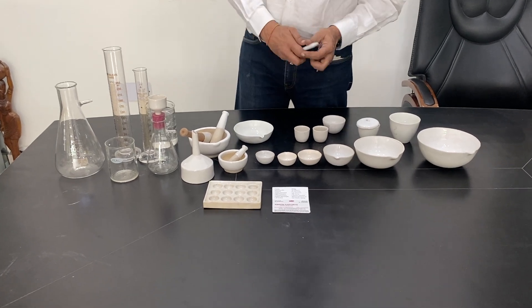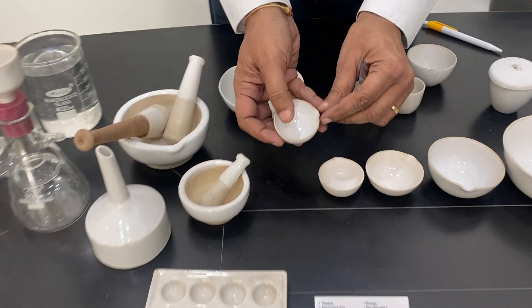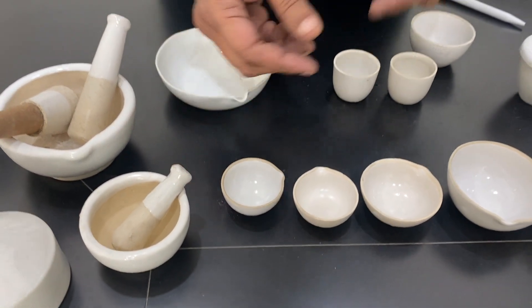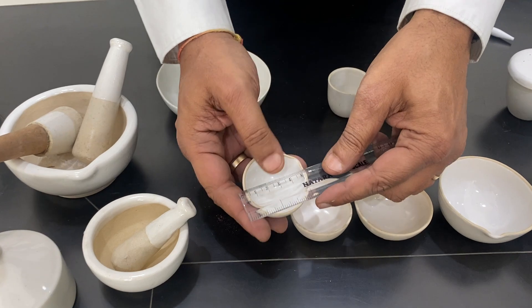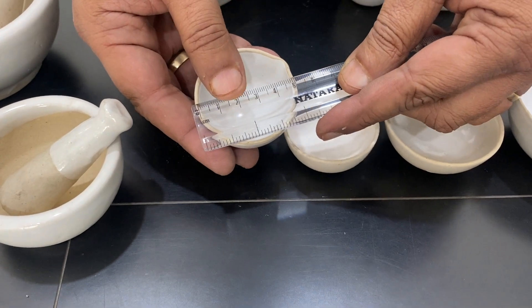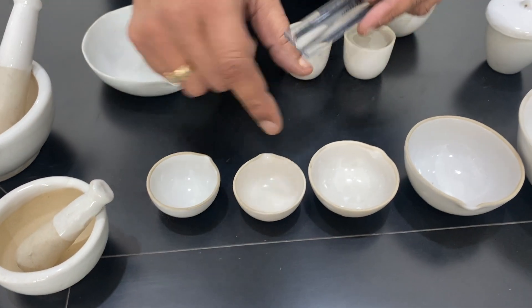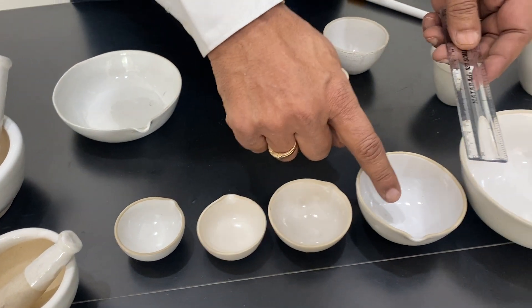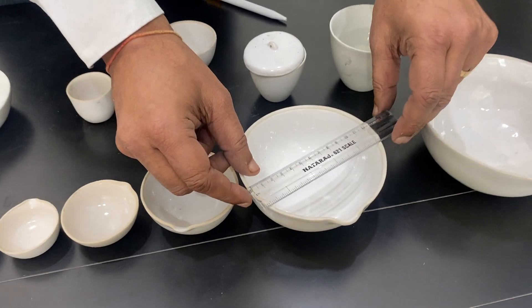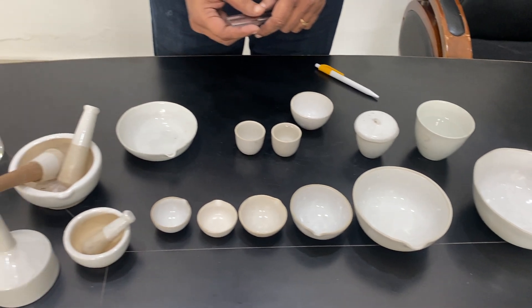These are called china dish. These are dishes with a lip on the side, which is used for crystallizing. It comes in different sizes — this one is measured from outside: 5 cm, 2 inches. Smaller ones are also there: 2.5 inches, 3 inches. And you can see the 5-inch one and 6-inch, and bigger sizes also come.